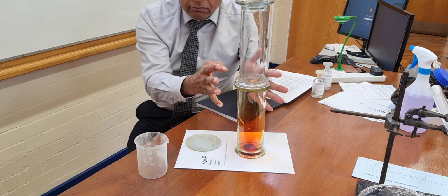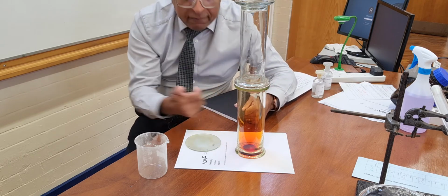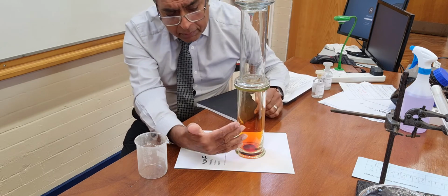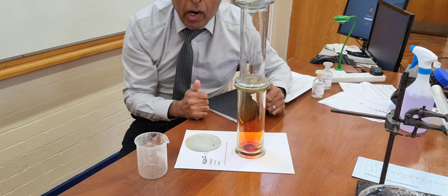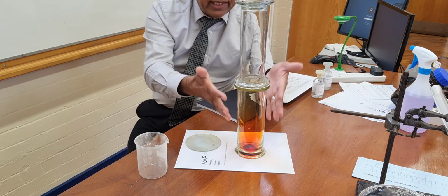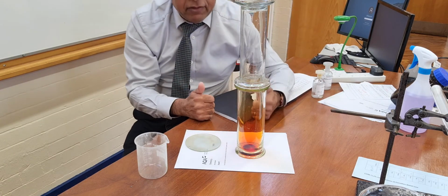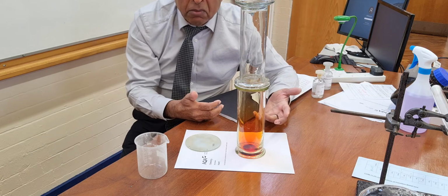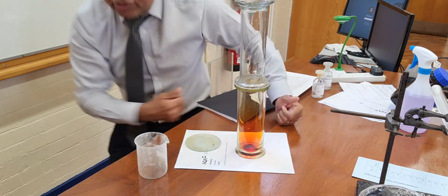This one, we should see the spreading within the lesson. In fact, you can probably see the spreading from the bottom up towards the top end of the gas jar while I've been talking to you. And if you keep watching it, it will end up as an evenly spread mixture eventually. Might take a few periods, but it'll end up evenly eventually.